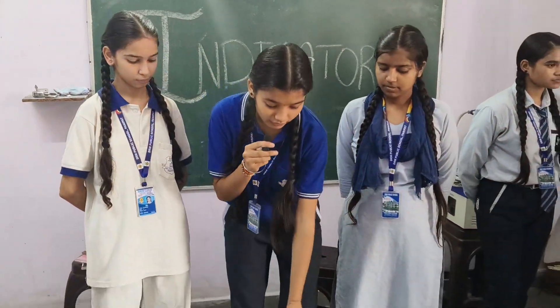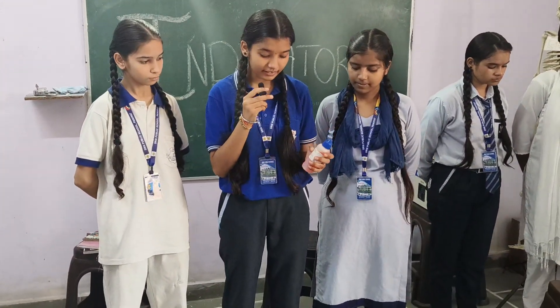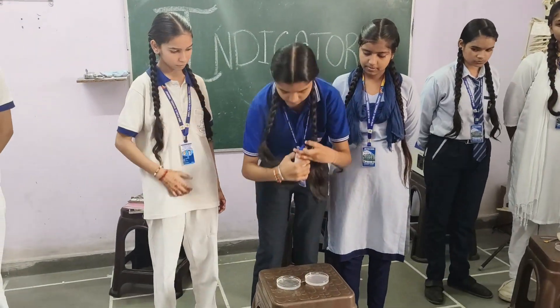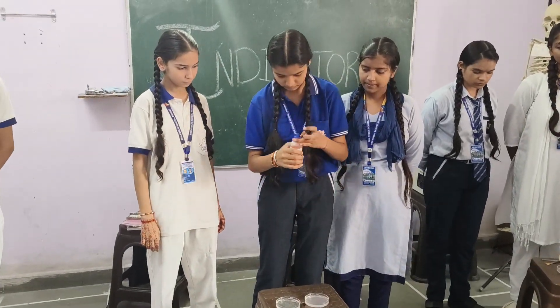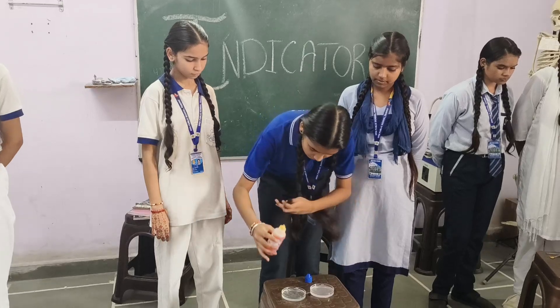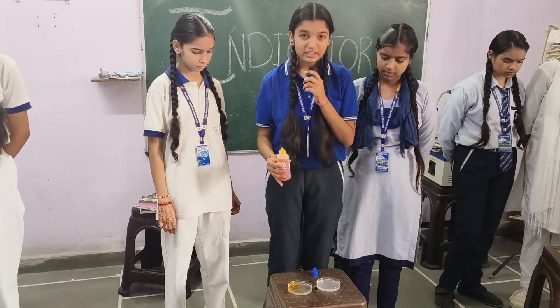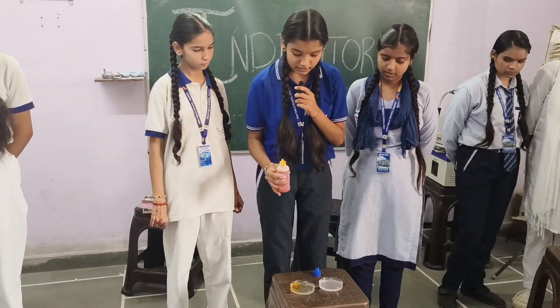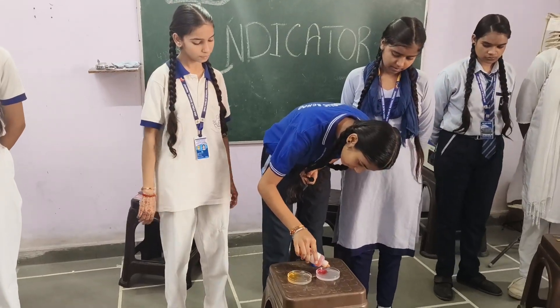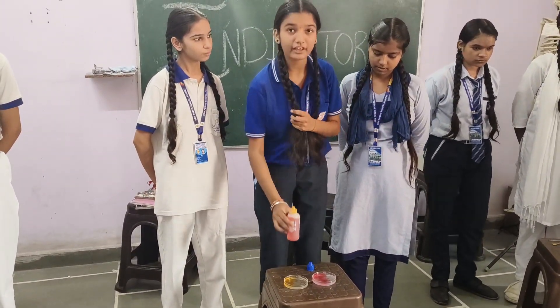This is methyl orange indicator. It is a synthetic indicator. Now we will check it. The color stays the same because it is a base. The color changes because it is acid.